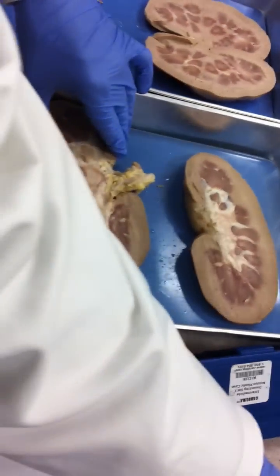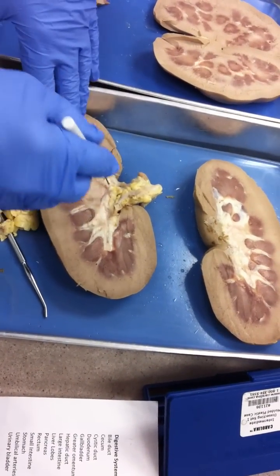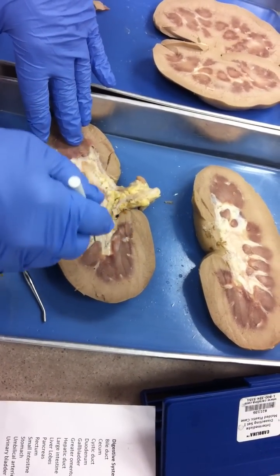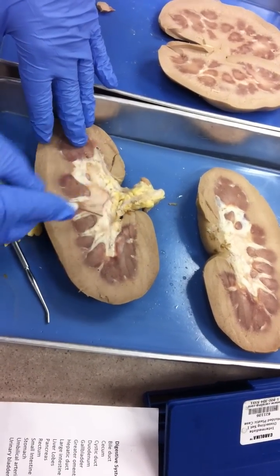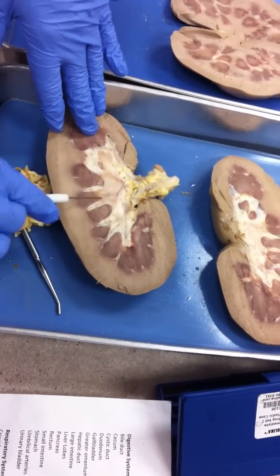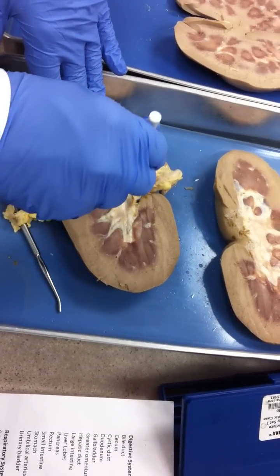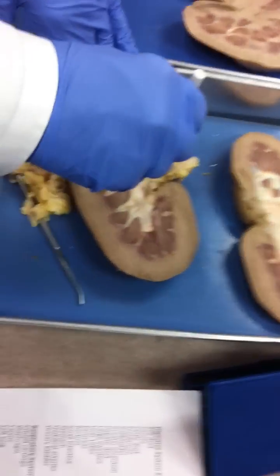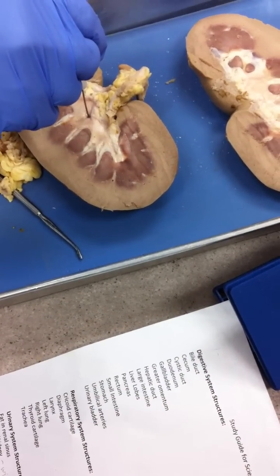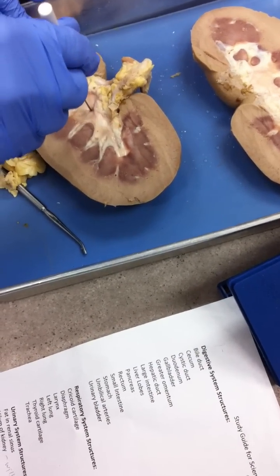The fat in the renal sinus is in the middle. Where you have most of your adipose tissue in the kidney is in the middle. Look at how that's encased in fat — that's the fat in the renal sinus. I'm going to pin right about in there, and you'll put fat in renal sinus.